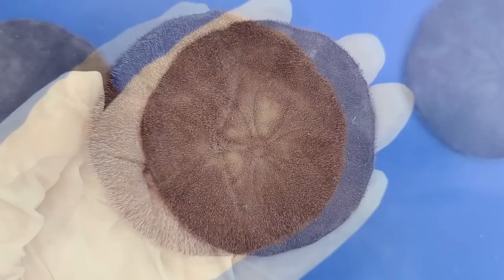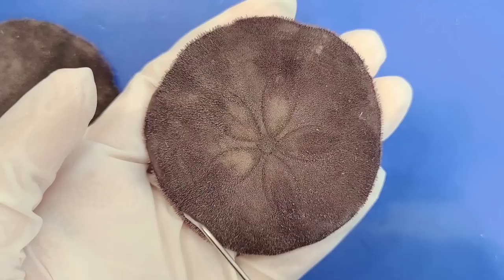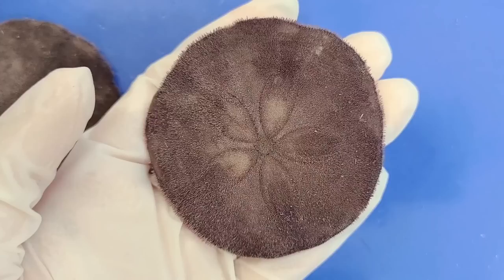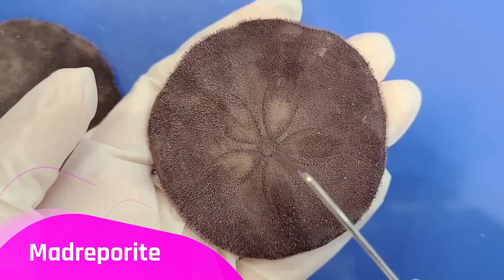I've switched to a different specimen to show you some other structures better. On the aboral surface, you can see this curious flower-like structure with five petals called a petaloid, which is a series of specialized tube feet that functions in respiration. Tube feet are operated by a water vascular system, which works through hydraulic pressure, allowing the sand dollar to move the tube feet by pumping water in and out. In the center of the petaloid on the aboral side is a pore called the madreporite.